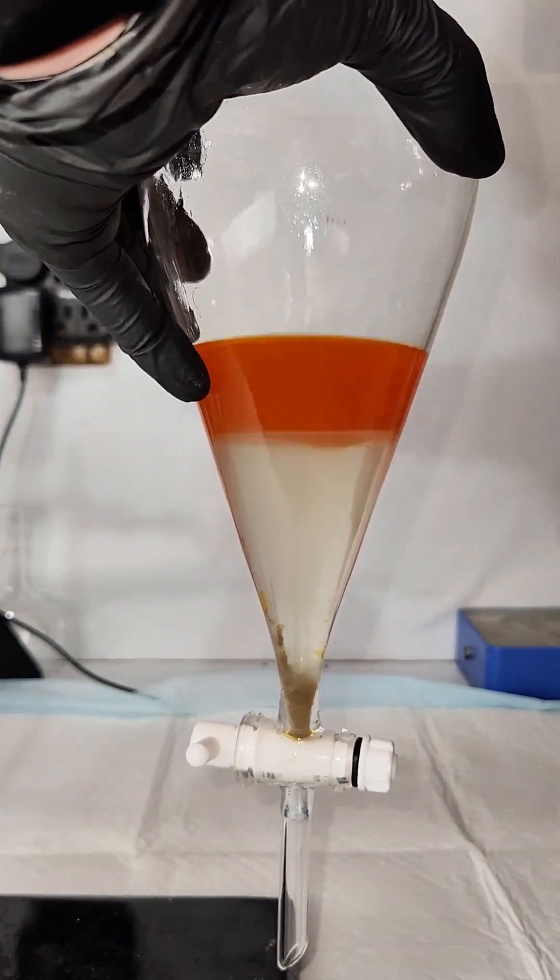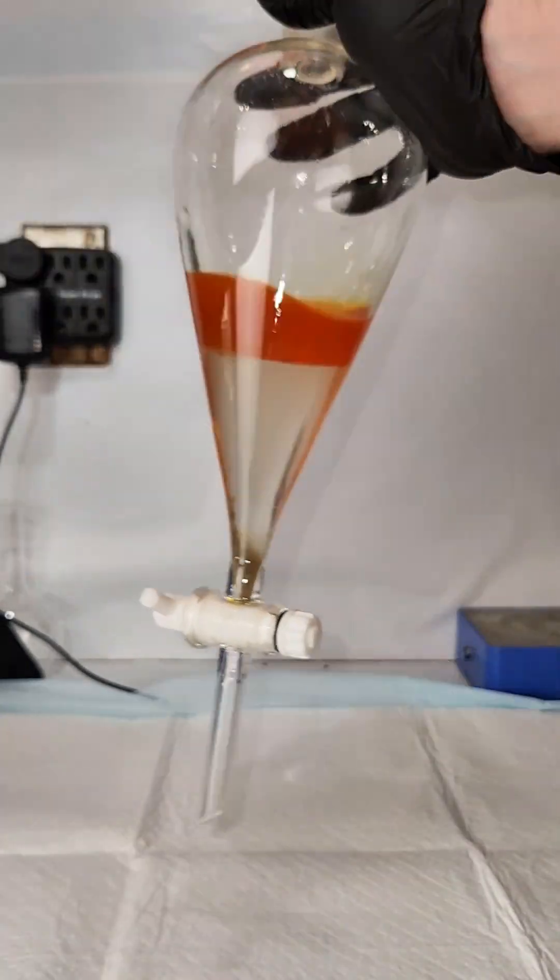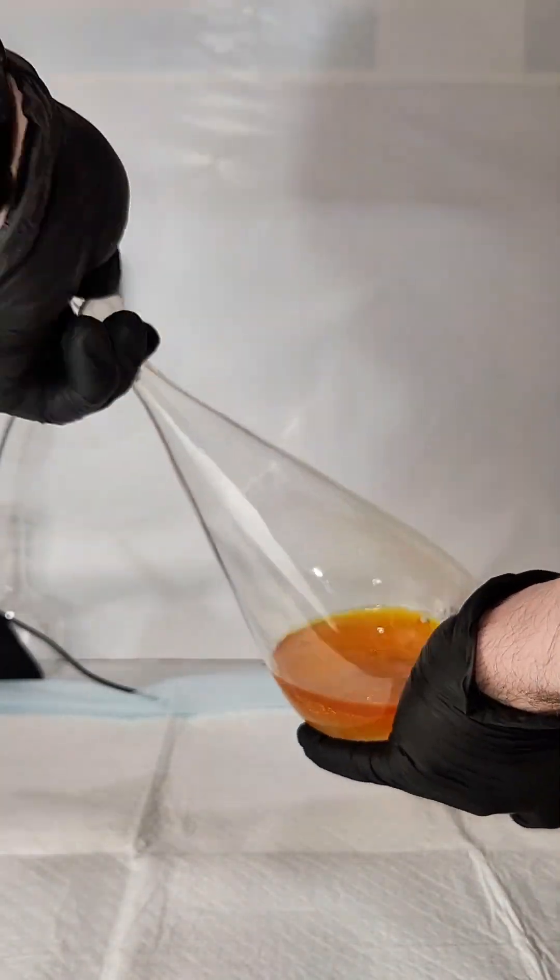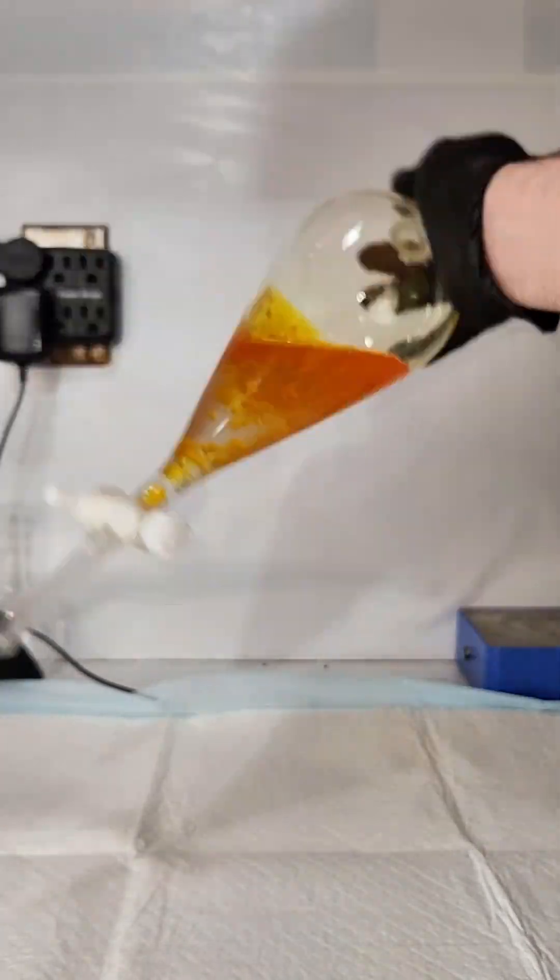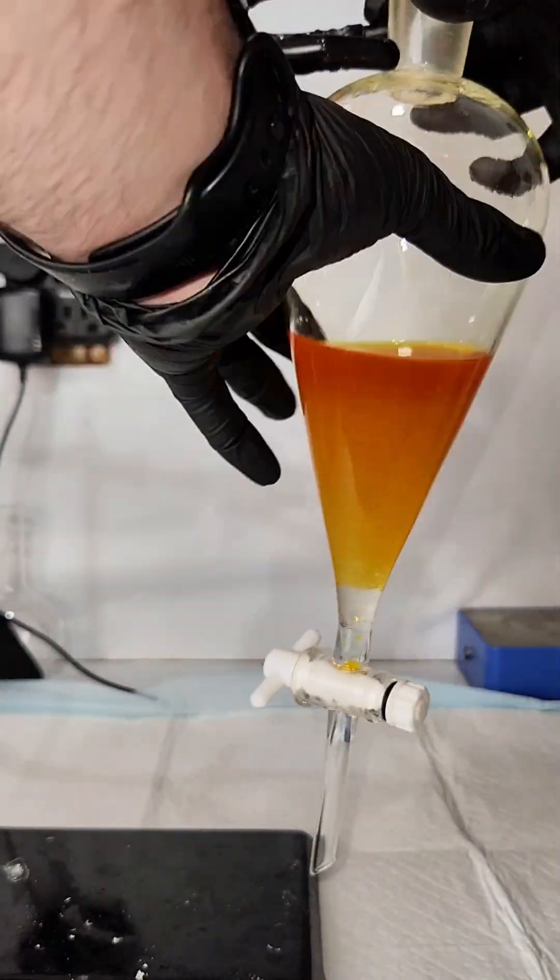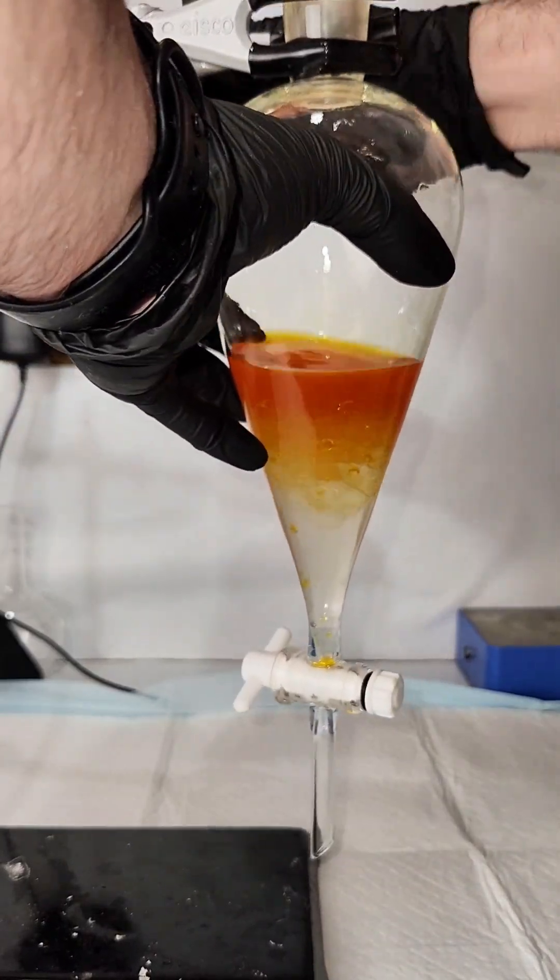Regardless, I want this color gone, and I begin by washing my benzene with distilled water in a separatory funnel. I'm not sure if this is actually necessary, but this is pretty standard organic washing technique, and old habits die hard.